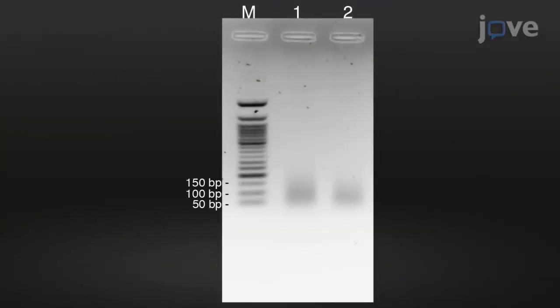At the end of the incubation, check the size of the probes on a 2.2% agarose gel.